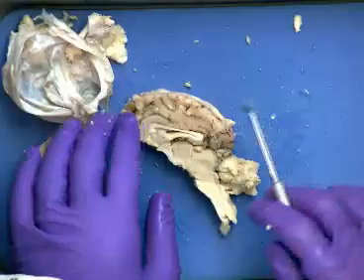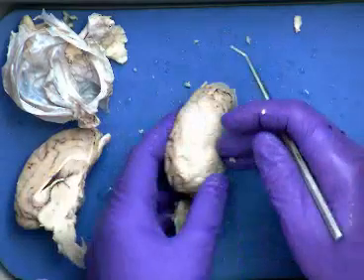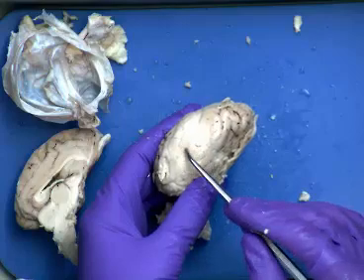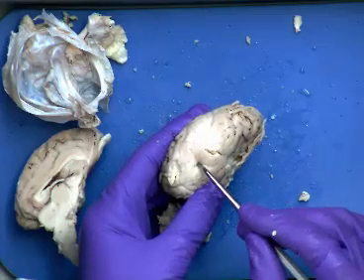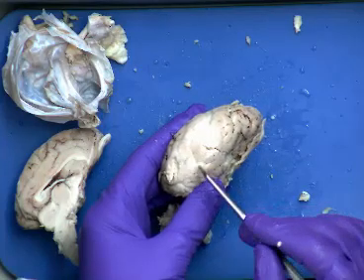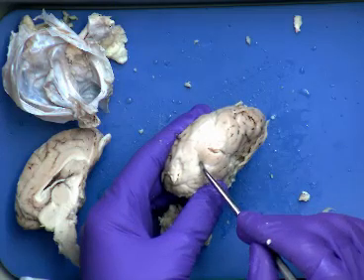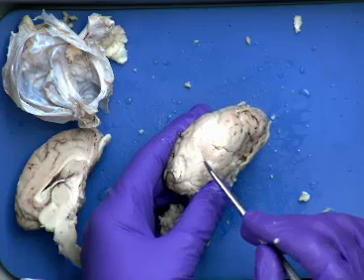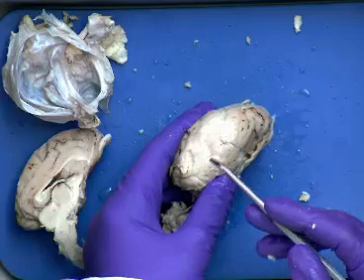Okay, so let me look at our list. Dura mater, pia mater, gyri and sulci. We know that the surface of the cerebrum has all these wrinkles to it, right? So it has these hills like this, and then it has valleys down below, right? So the valleys are called sulci, and the hills, if you will, are called gyri. An individual one is called a gyrus, or an individual groove or valley is going to be a sulcus. So again, it's like cactus and cacti, sulcus and sulci, gyrus and gyri. So you're seeing the plural in the list there.